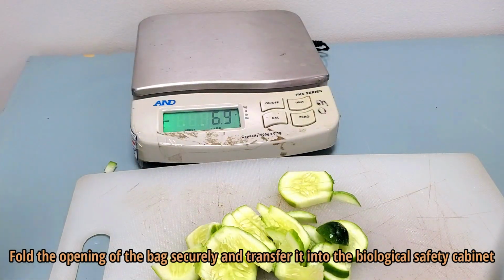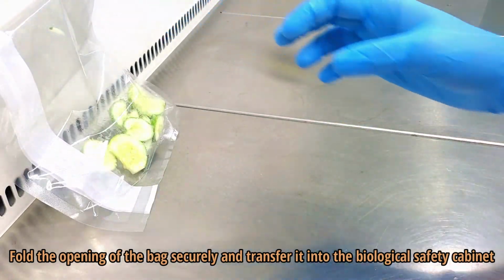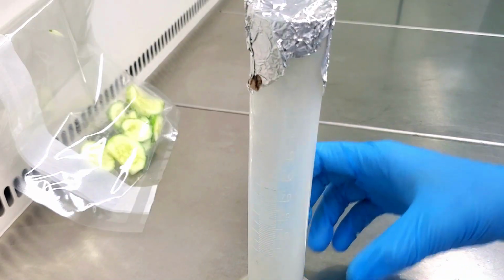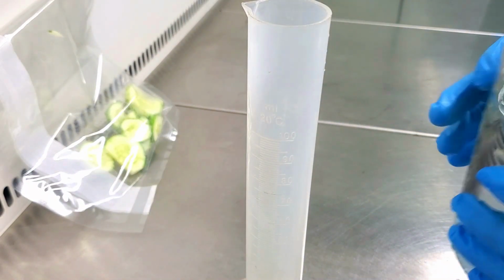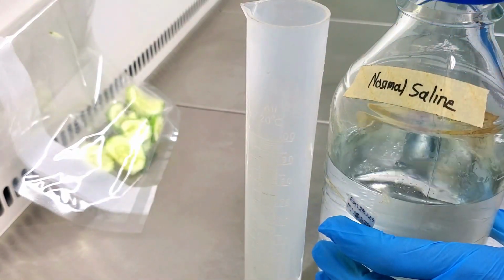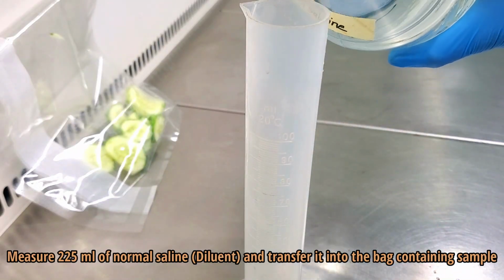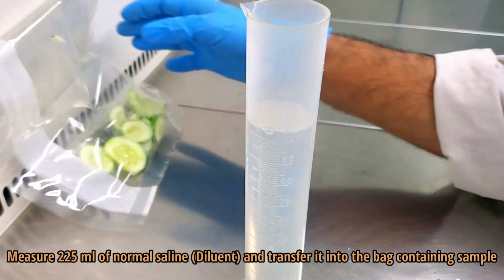Take the bag into the biological safety cabinet. Measure 225 ml of normal saline and transfer it into the bag containing sample.